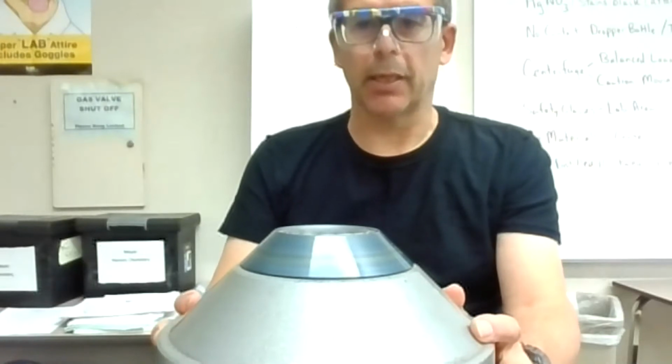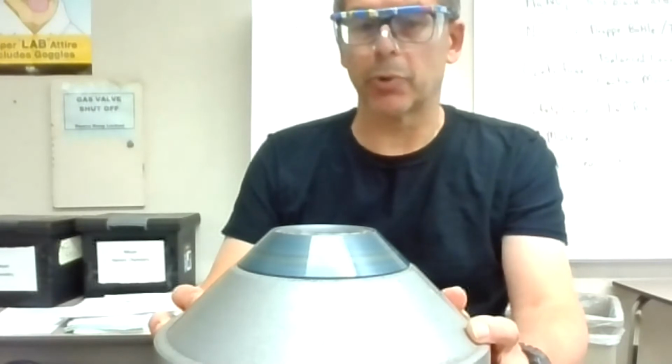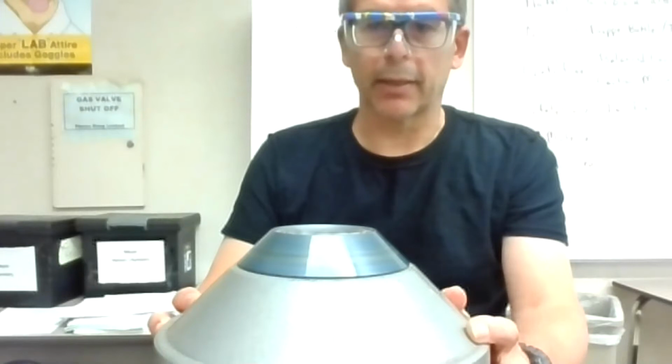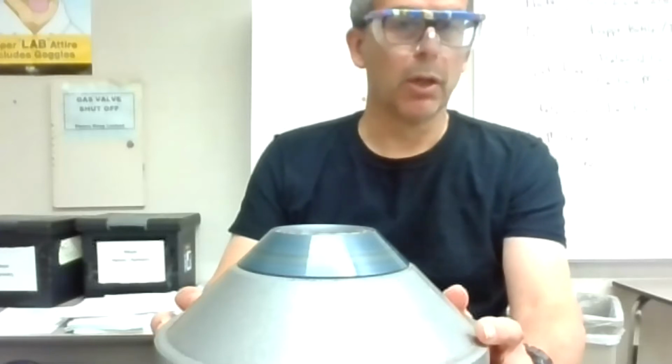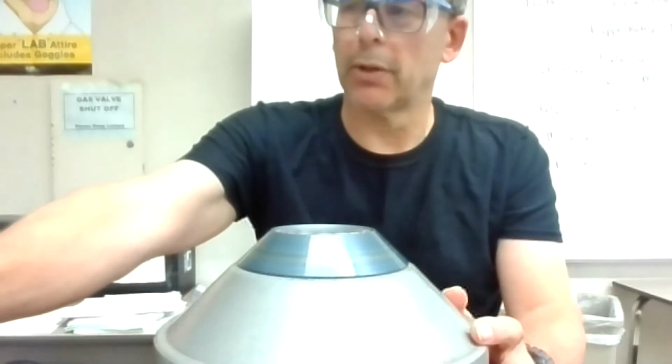If you don't mix it, and I think you got to do that quick invert once or twice, then you might not see that. Okay, and then the magnesium could interfere with other steps too. So you got to get that gel-like thing, and it's got to be a quick ready mix. Just letting this go because I don't know how well. This one tends to be a little fussier, it needs to centrifuge real well.